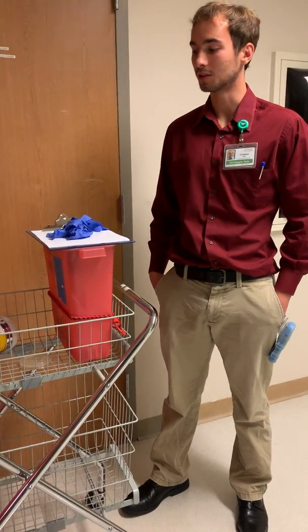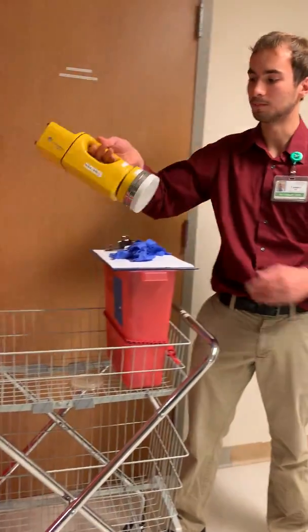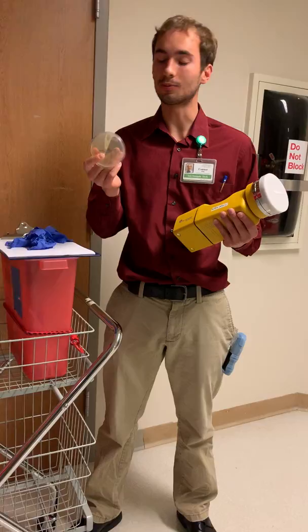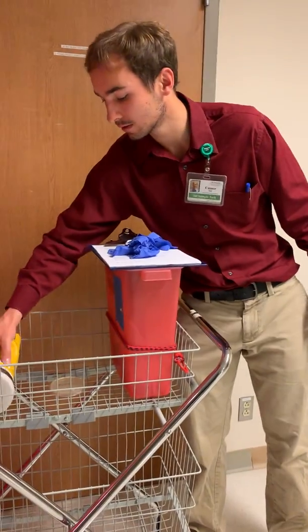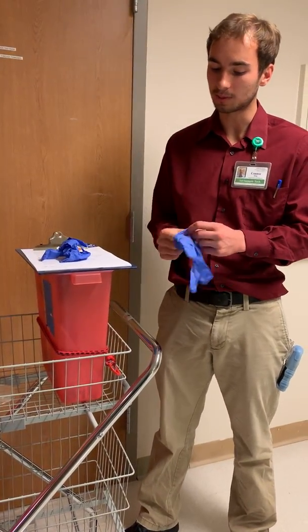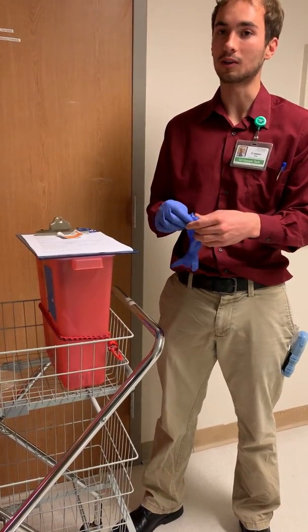Today we're going to go over how to conduct a surface air sample on an agar plate using an inhibitory mold agar. We select for fungal spores, typically with particular interest in looking for Aspergillus. Our protocol is a little bit stricter because this is mostly for a clinical setting.